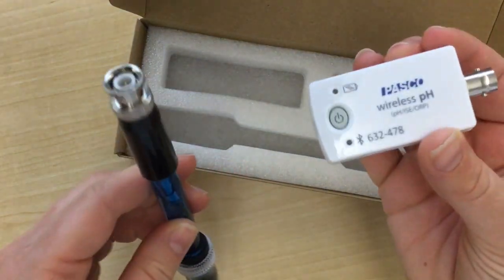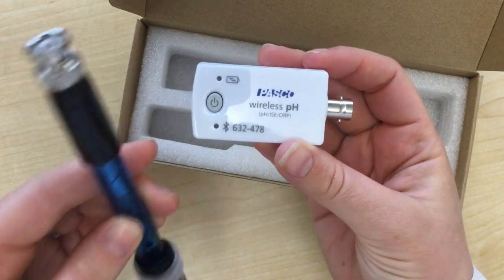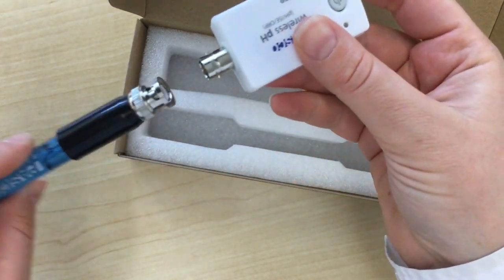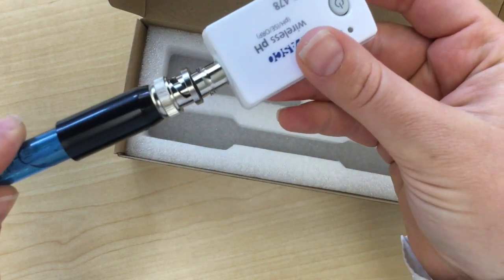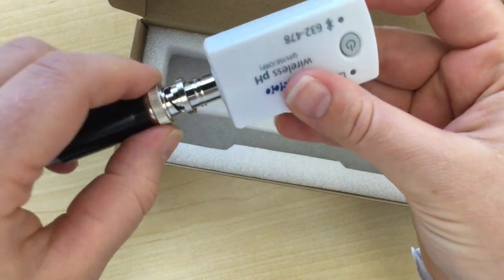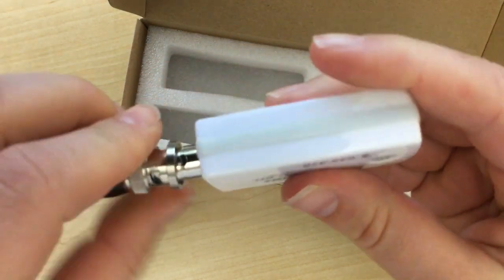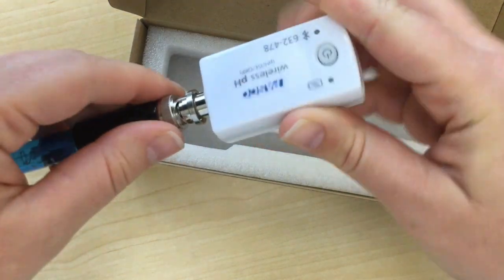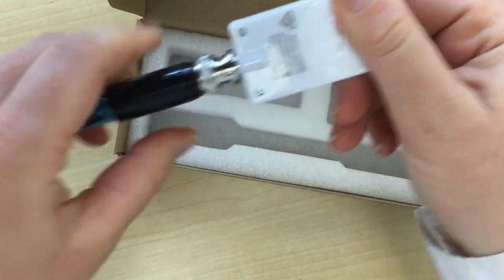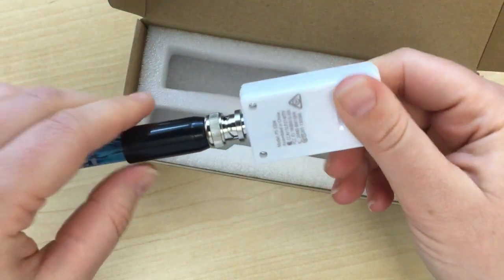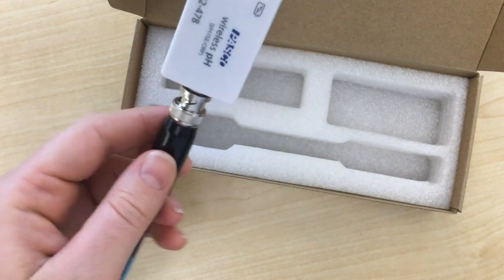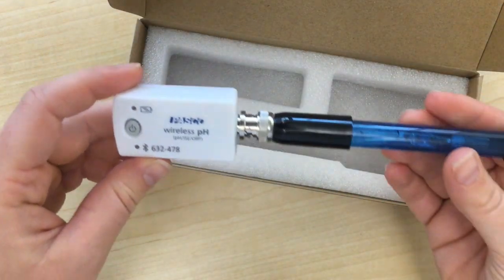You'll first need to connect your wireless sensor into your probeware. Find the end and it'll fit in where there's an opening, and then you'll twist it around to lock. Once that's on, you'll be ready to use it with your phone.